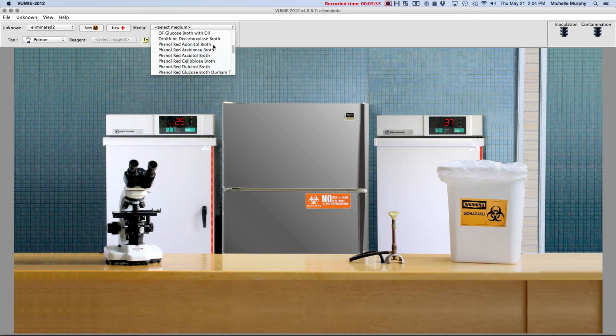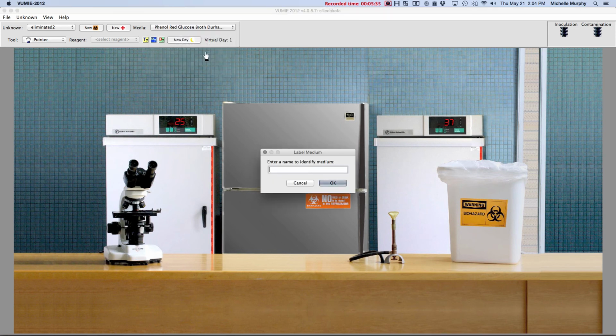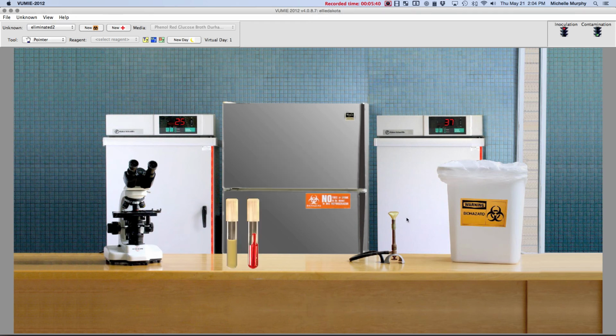So I'm going to do a phenol red glucose broth test, Glucose 1. And I'm going to show you how to go through this process. To go through the process of inoculating the unknown so that we're not guessing, you're going to pick a loop, and we're going to have to flame the loop, and flame the tubes so that we sterilize them. Right click, turn on your burner, right click, remove your caps. You're going to burn the loop. It's called flaming the loop, so that you get it nice and sterile.